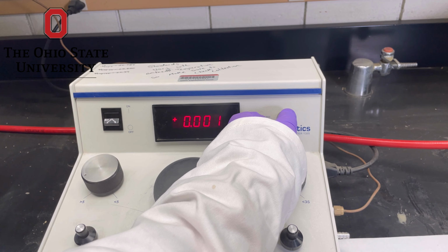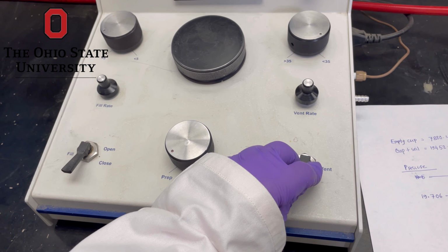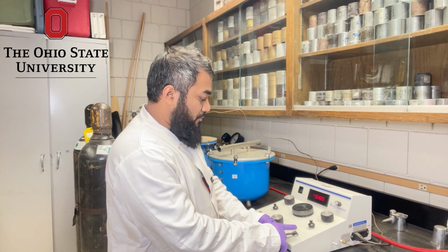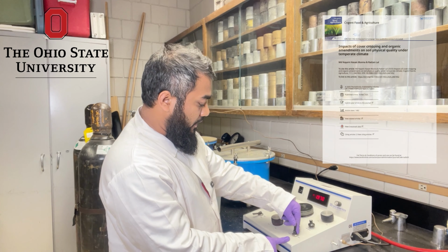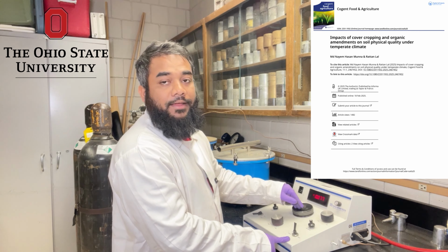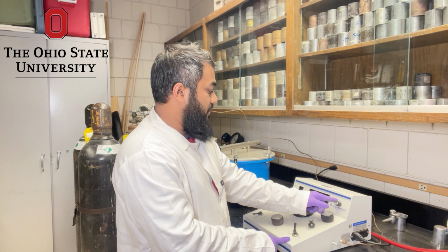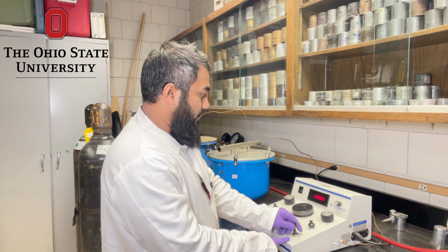We have to close this lid very tightly, and then run the measurement. You can see here is a button for 0, and here is another one for vent, here is another one for fill. So we will remove all the gas in the chamber by using this open or close. We will open this, and all existing air will be removed from here. And when it is near 0, we will use this to make it exactly 0, and then we will close it.